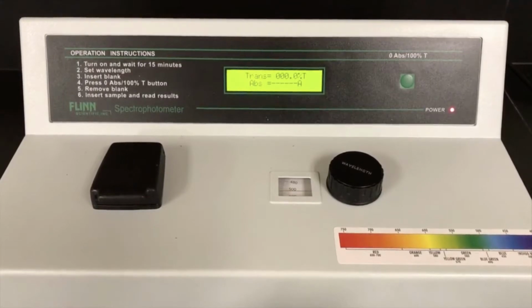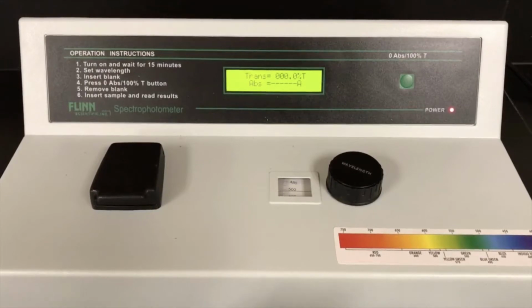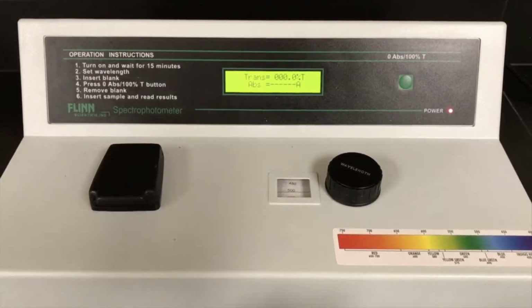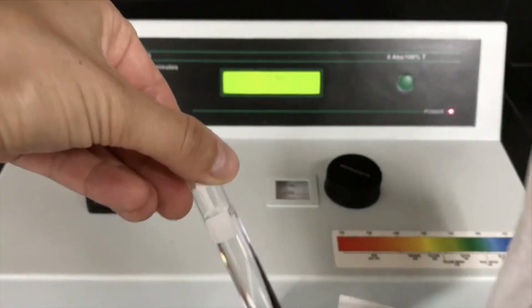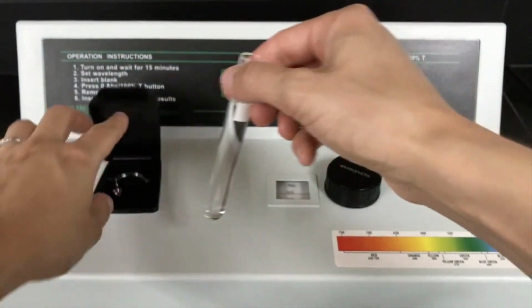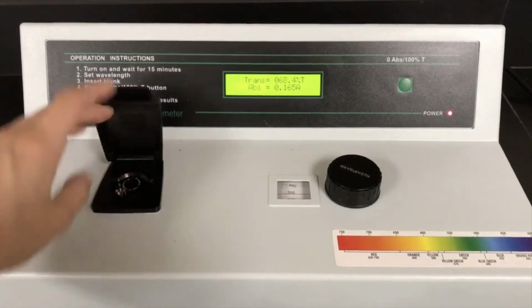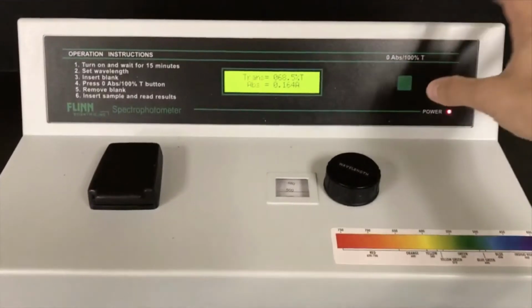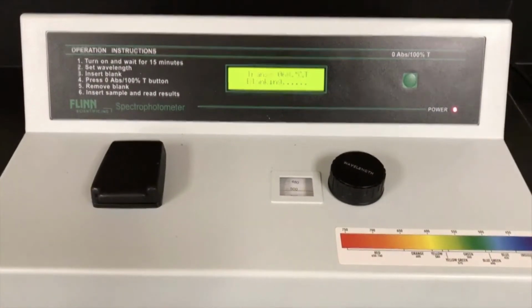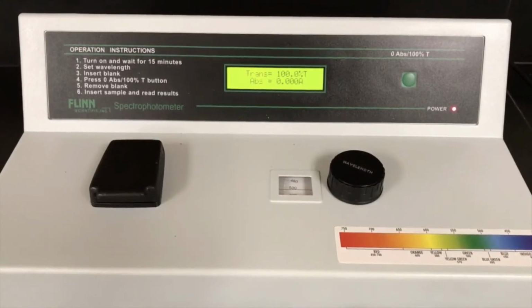So this is the spectrophotometer. What we're going to do is we first need to zero this. Okay? So the way we're going to zero it is we're going to add a solution of just water. Okay? So for each case, just in case there's water, you're going to take a Kim wipe and wipe it off. And then you're going to open the spectrophotometer and carefully, don't push too hard, push the sample in. Okay? So if you notice, it's not at 0 right now, so I'm going to hit 0 for it to 0. Okay, now I can use the sample.